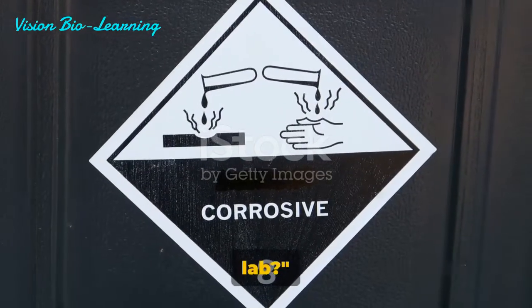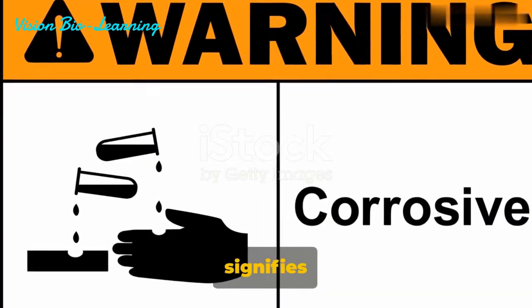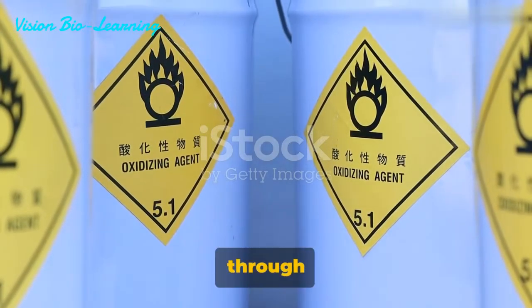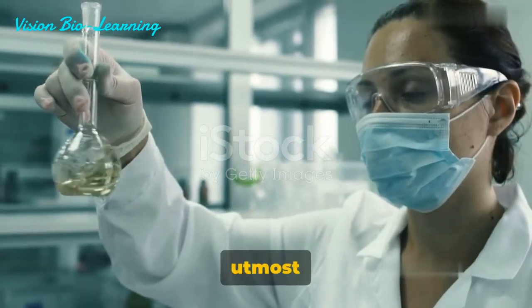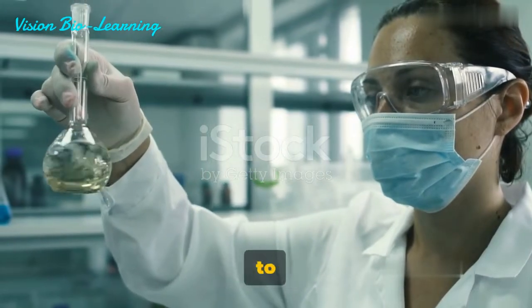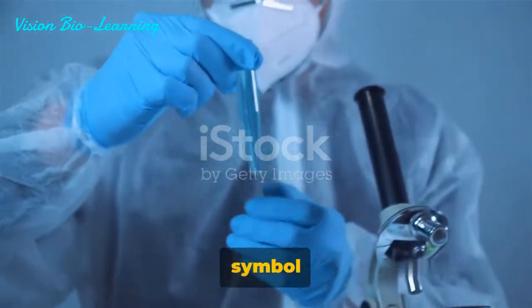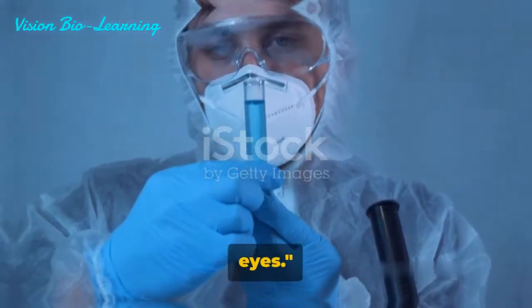Ever seen the corrosive symbol in a lab? This symbol, depicting a substance being poured onto a material and hand, signifies the presence of corrosive substances — materials that can degrade or wear away other materials through a chemical reaction. In a laboratory, this symbol alerts us about substances that can cause severe damage to our skin, eyes, and other body parts. It's a stark reminder to handle these substances with utmost care.